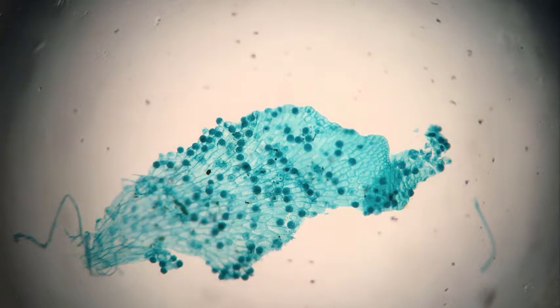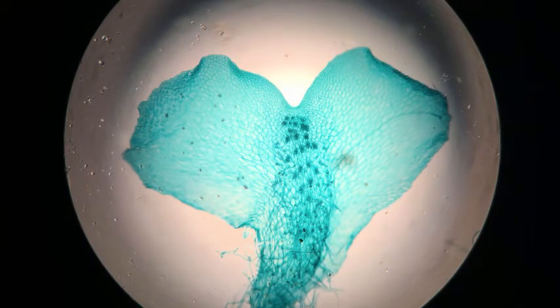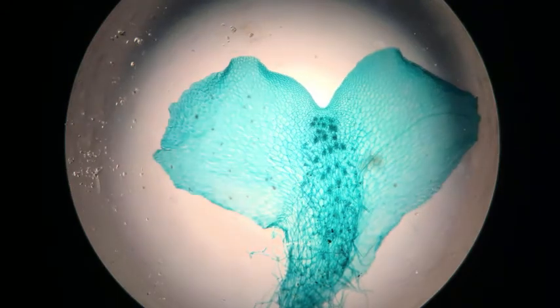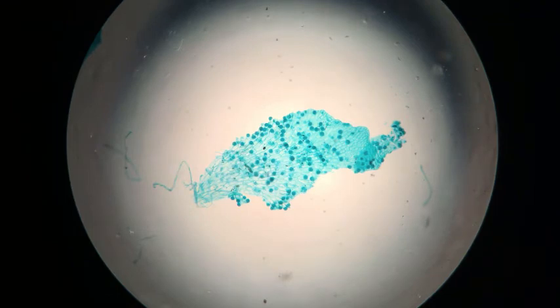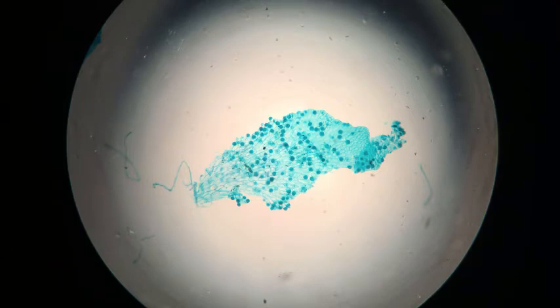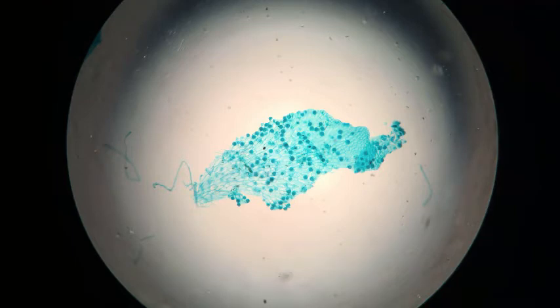You can actually see this in the slide with dioecious prothalia—male and female on the same slide. The male and female look totally different, even though they're the same species. The female is a normal heart-shaped prothallium with archegonia just below the notch, while the male hardly looks like the same thing—it never grew large enough to develop that typical heart shape, but it is covered with antheridia. Big and strong: female. Pathetic and weak: male.